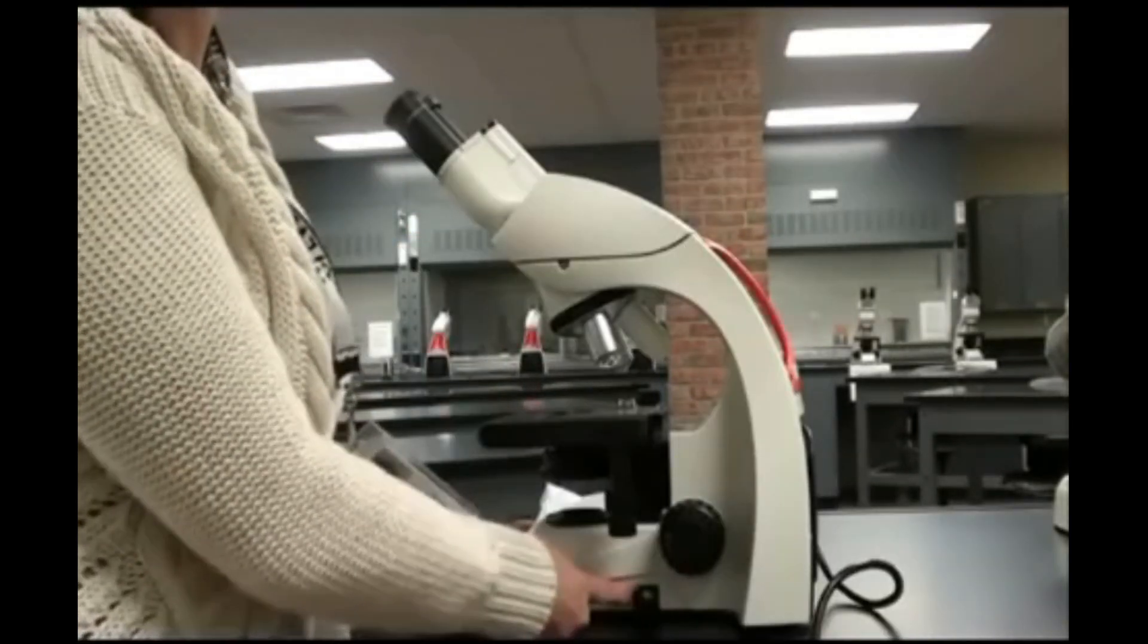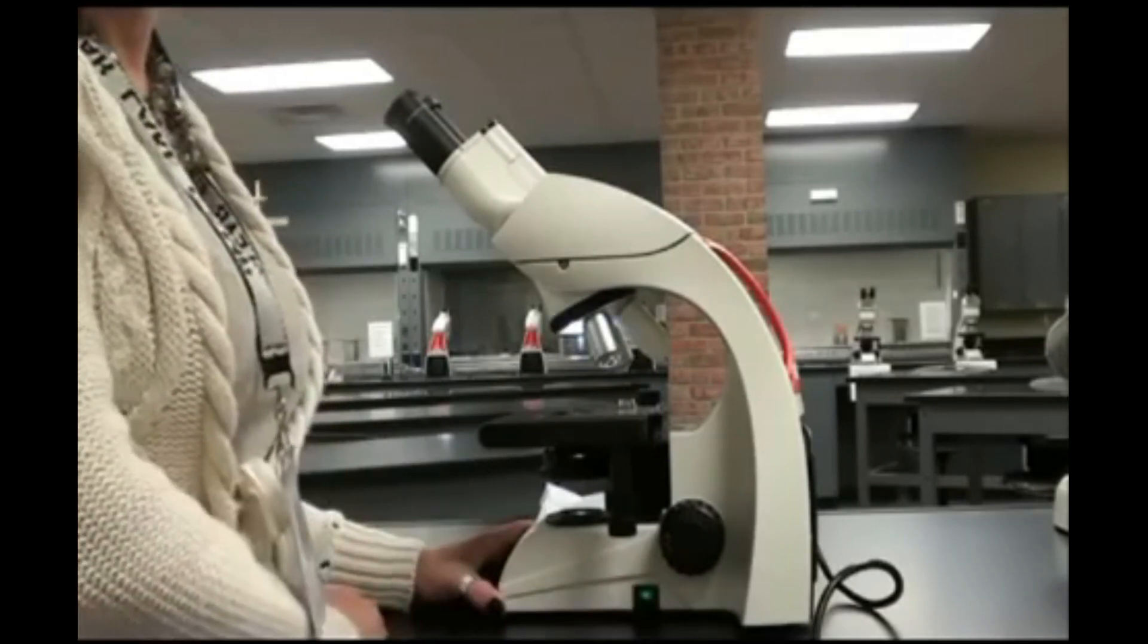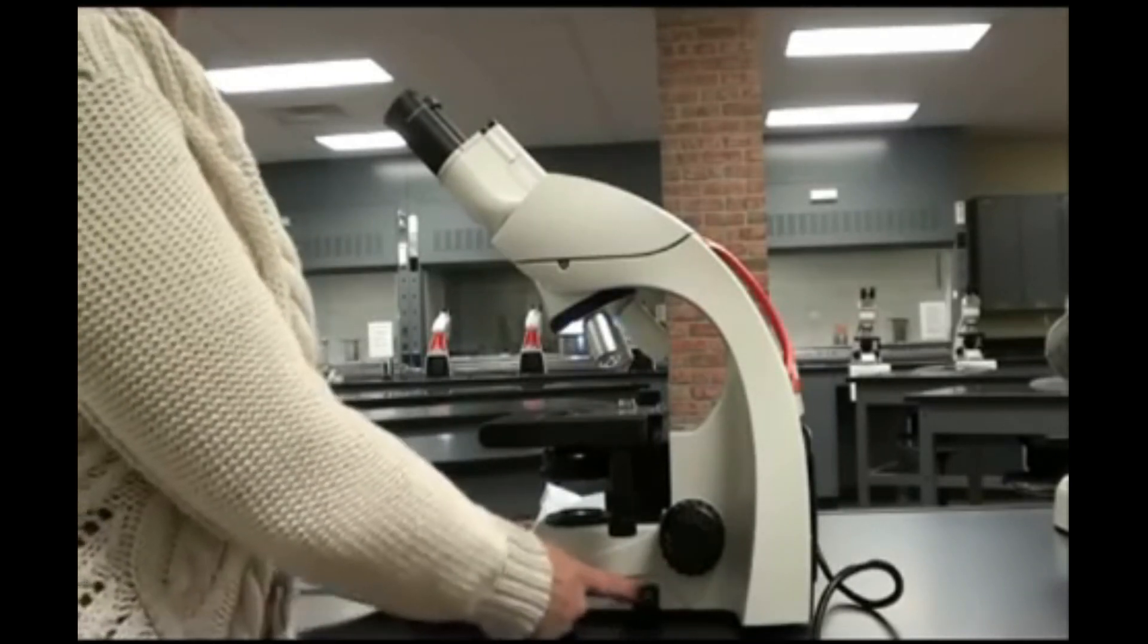Compound light microscopes typically have an on-off switch in the base. This switch lights up when I have it turned on.